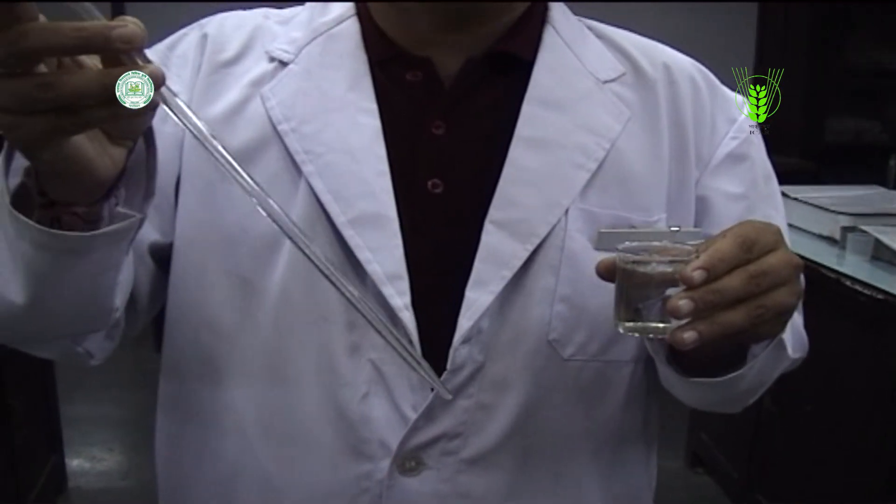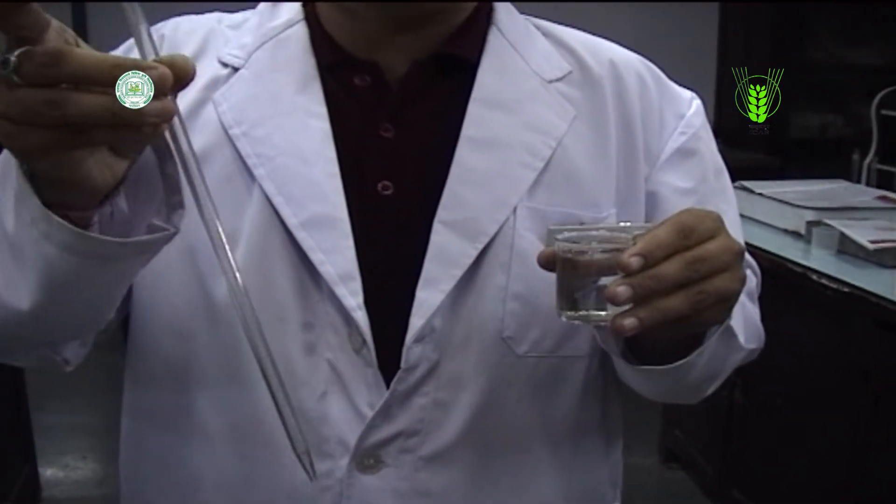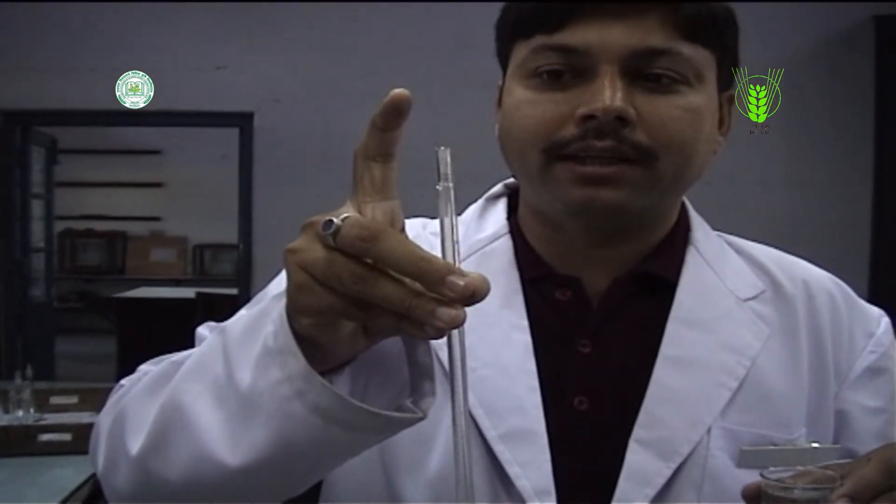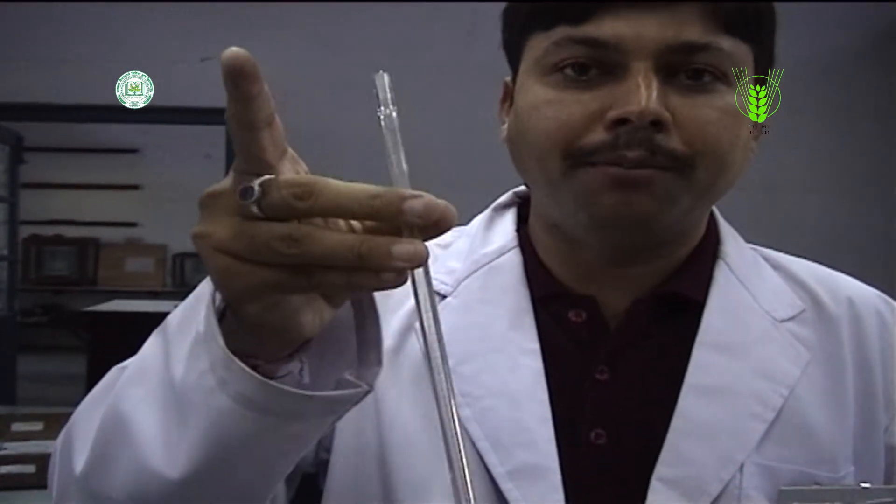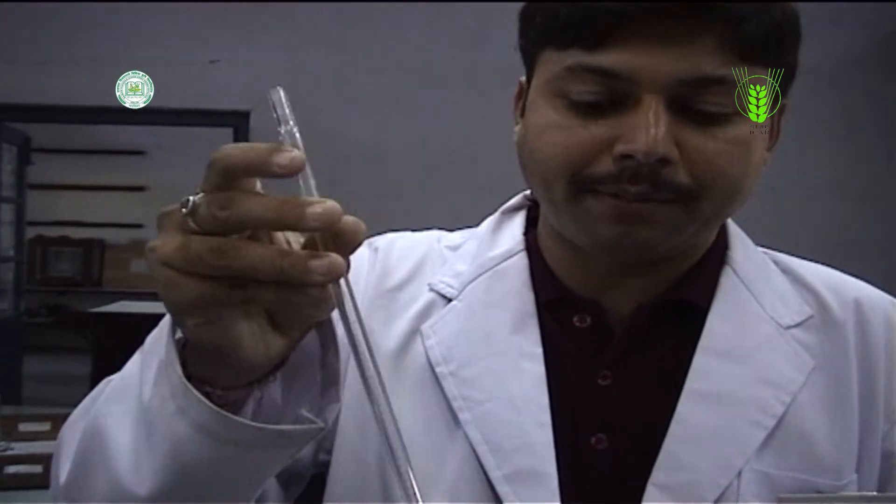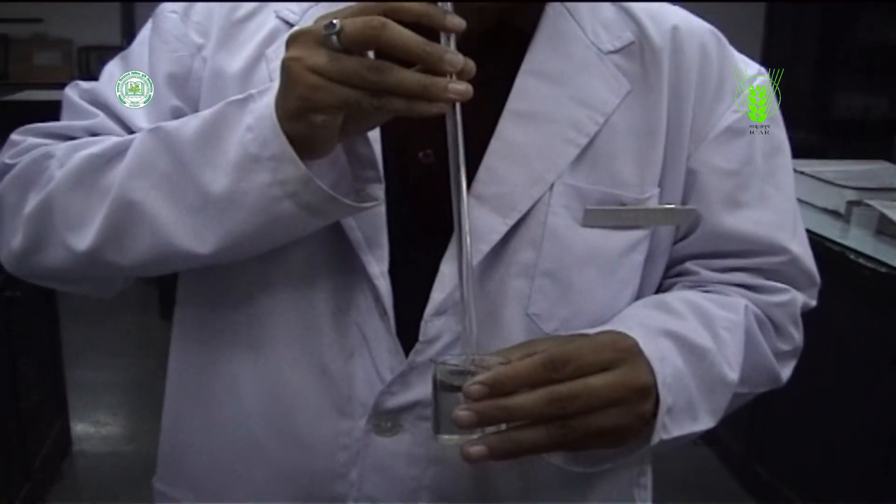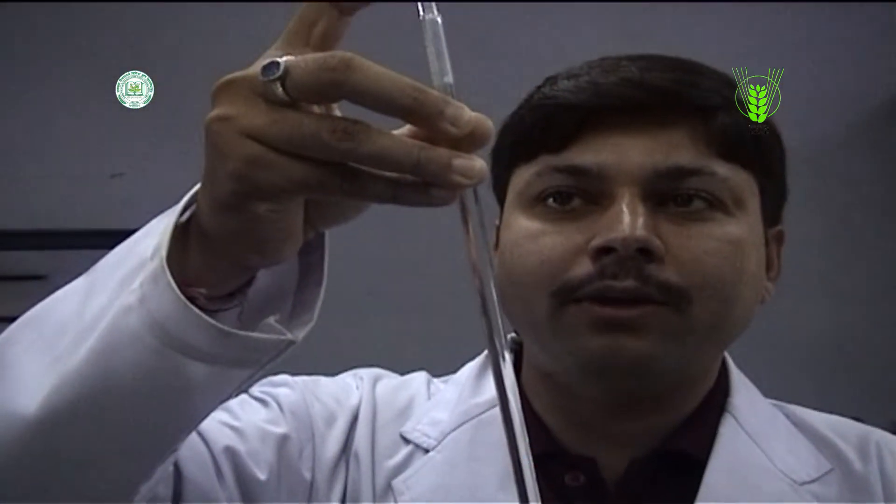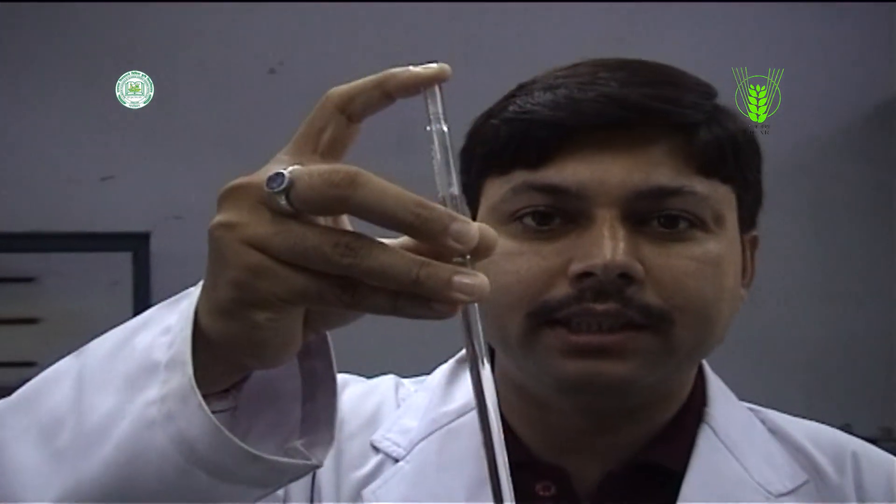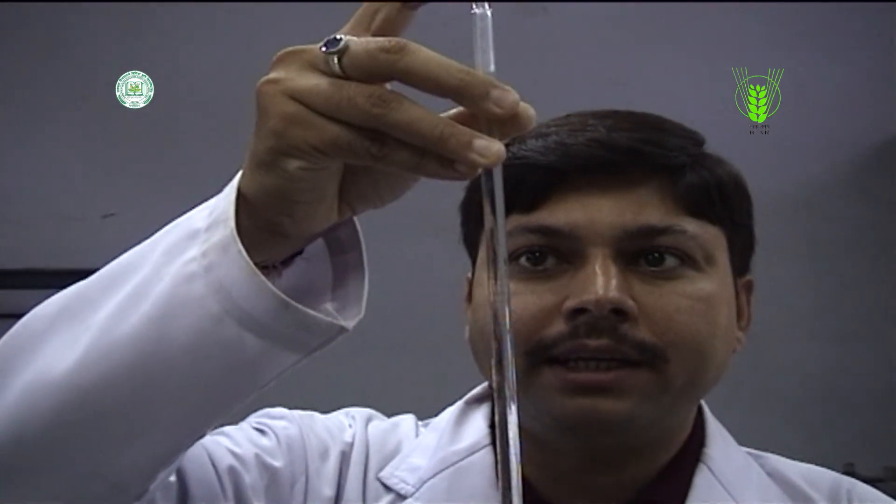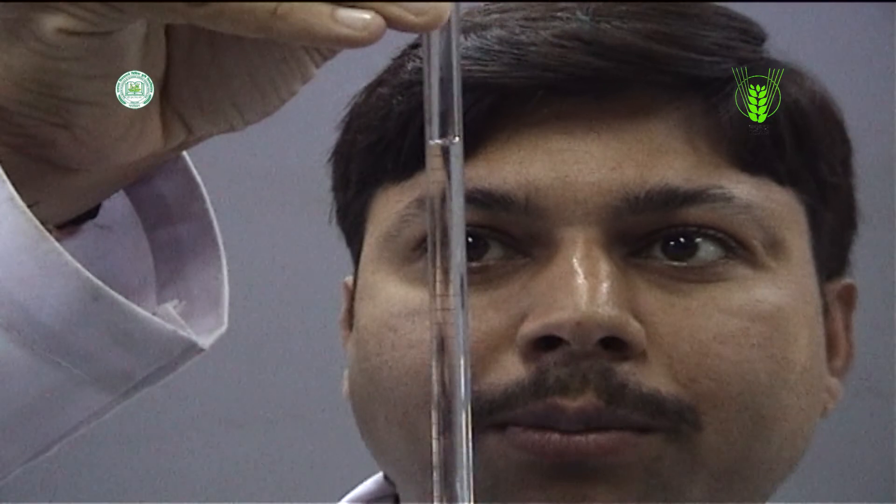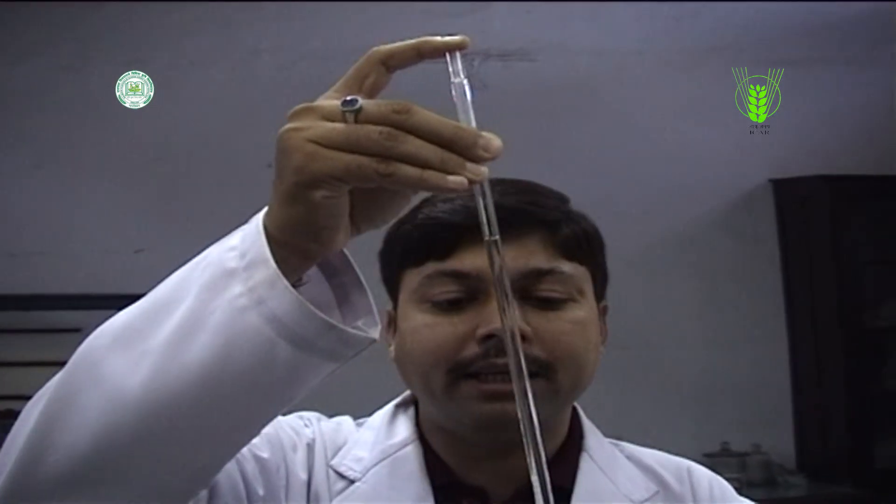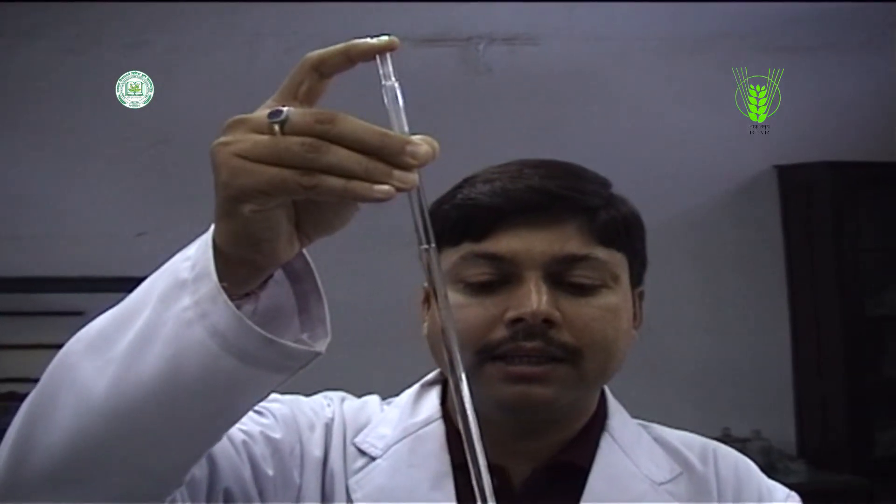Use of pipette. Insert the tip of pipette into the beaker of solution so that it is about one-fourth inch from the bottom. Be sure not to press the tip against the bottom of the container. If you are right-handed, hold the pipette in your right hand, leaving your index finger free to place over the top of pipette. With your left hand, squeeze the pipette bulb. Press it firmly over the top of pipette, but do not insert the pipette into the bulb.